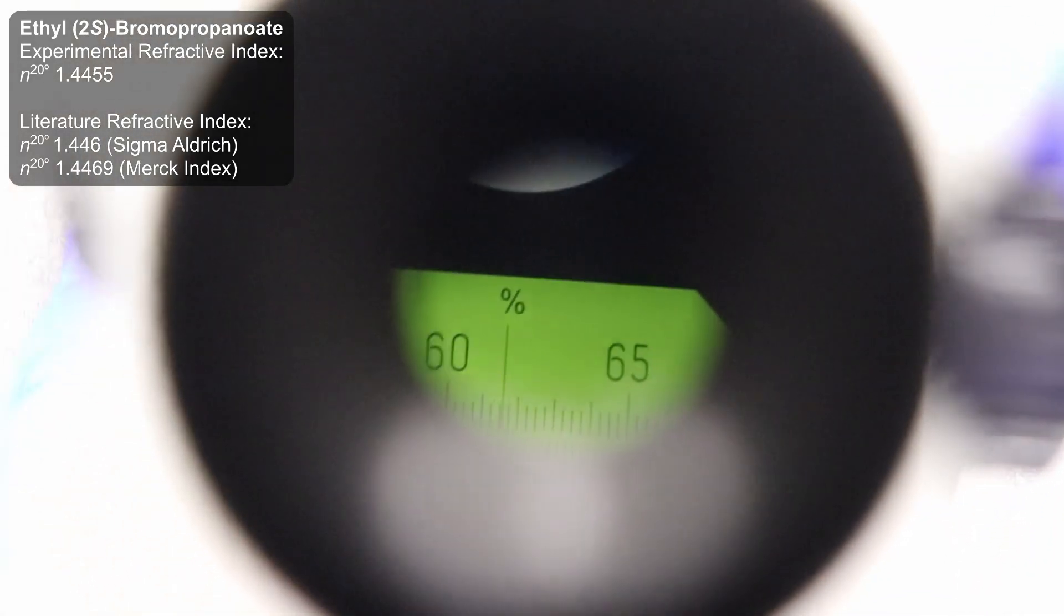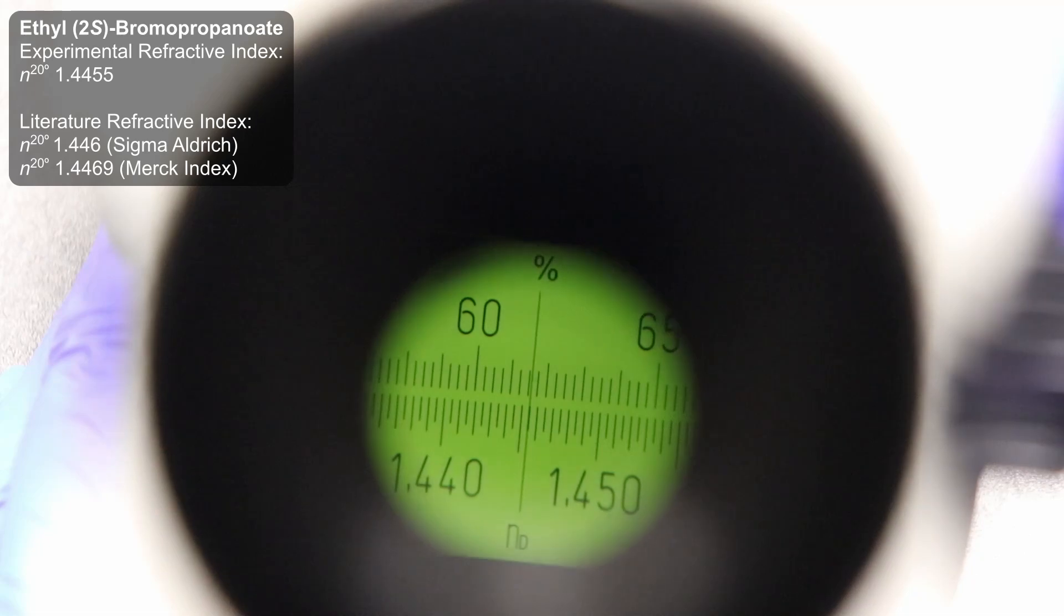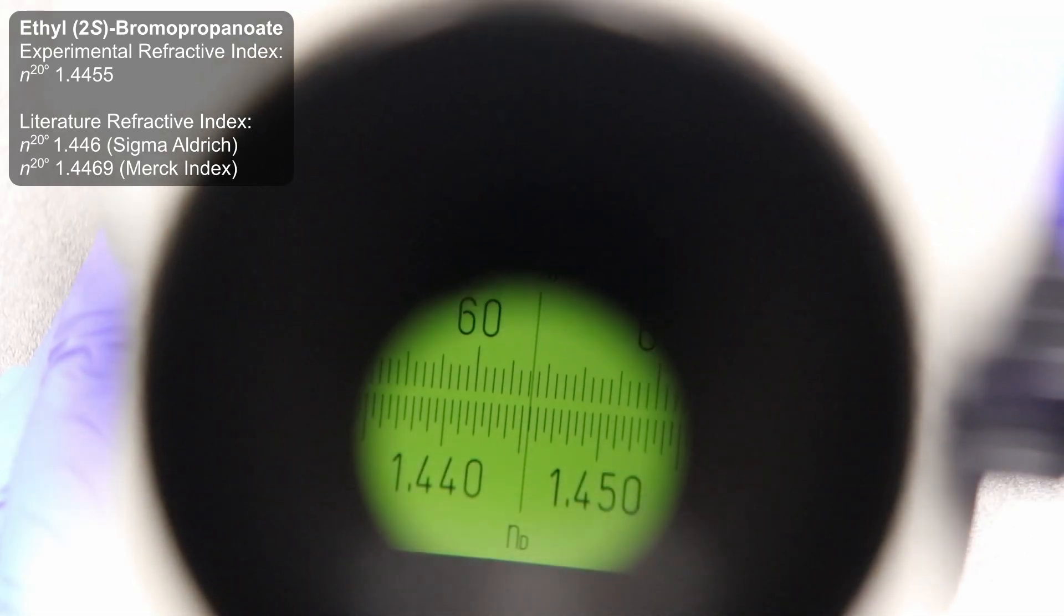I then read the refractive index, finding it to be 1.4455 at 20 degrees Celsius. This closely aligns with the reported refractive index values of 1.446 and 1.4469, listed by Sigma and in the Merck index.